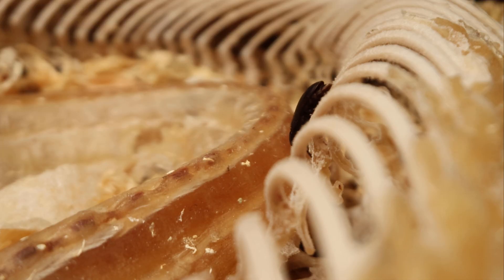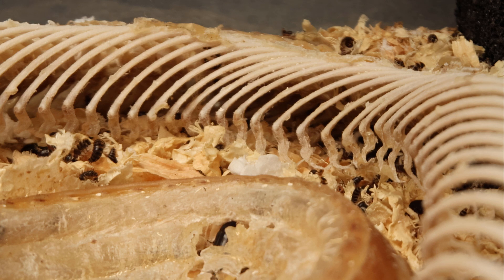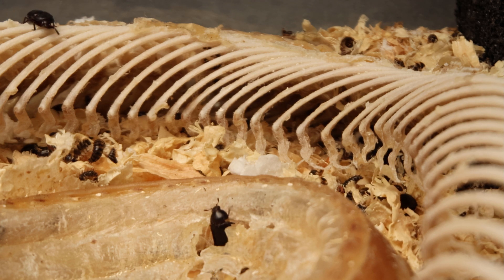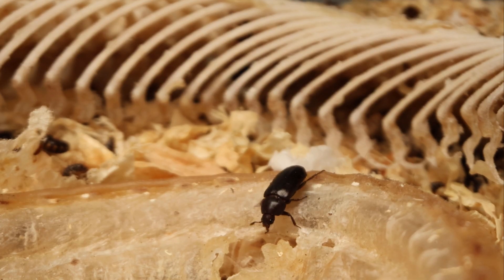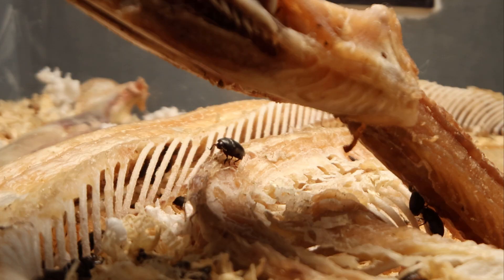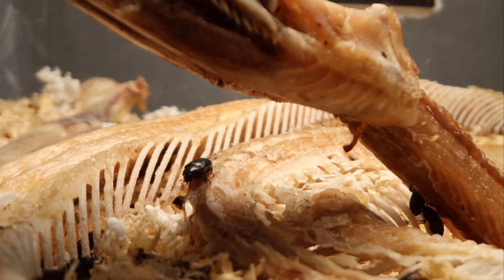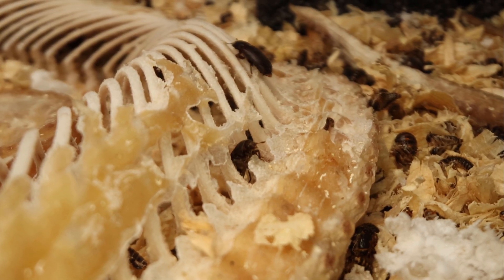They prefer moist food to rock-hard months-old snake flesh, and I do give them fresh meat to supplement their diet, so it will take them a little while but I'm not in a rush. The whole colony gets stuck in from first instar larvae all the way up to adults. Each takes their tiny mouthfuls as they chomp away at the flesh and you'll see the skeleton gradually emerge. A well-managed colony has no smell at all, even when it's working on something as big as this, providing it's kept properly dried.